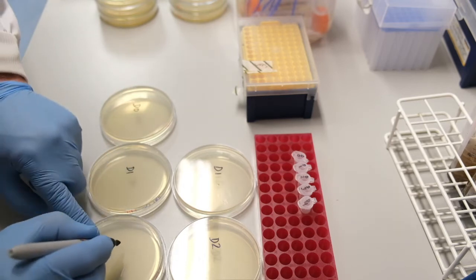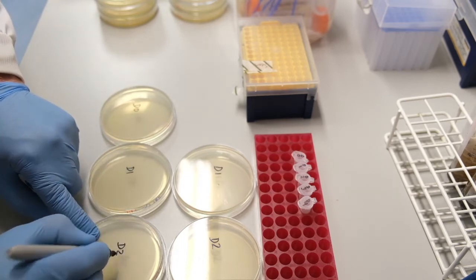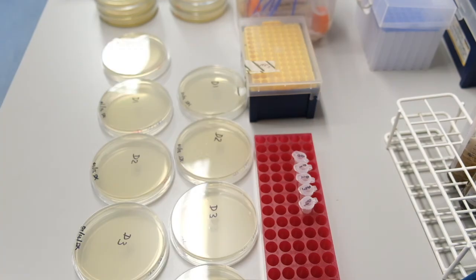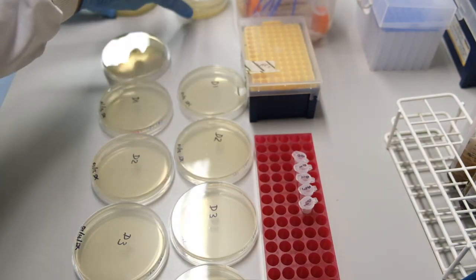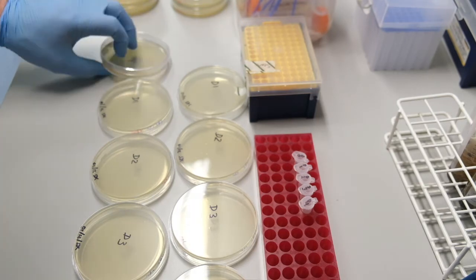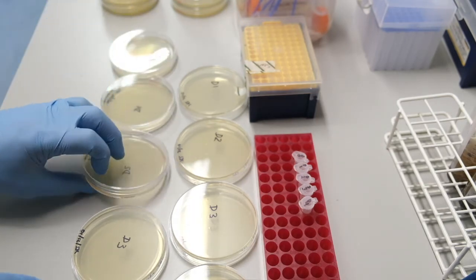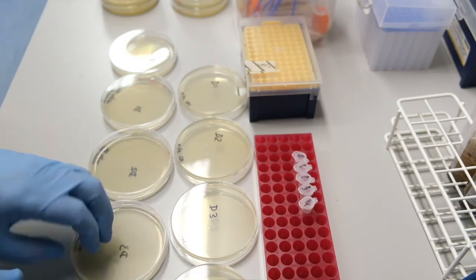We expect to obtain more colonies on the plate without nalidixic acid. For this reason, we only plate the undiluted cells on the plates with nalidixic acid. Turn the plates over ready to pipette your cells.